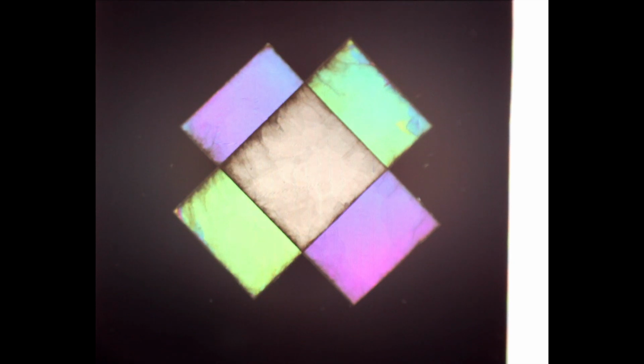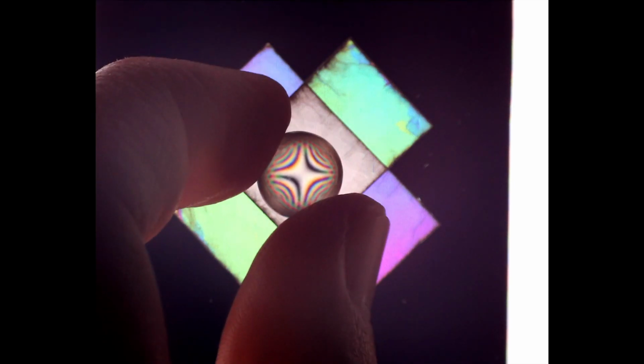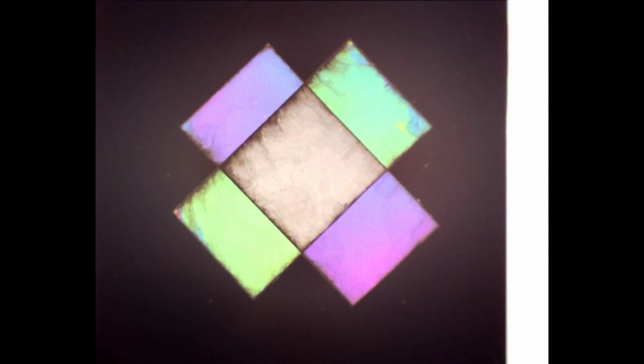Now let's bring in our converging lens to investigate our interference figures. Our interference figures where our mica plates do not overlap haven't really changed at all from before. However, where we have our plates overlapping, we see this totally different and kind of complicated interference figure. I'm thinking I'm going to need a real physicist to help me out with that one. That one there is complicated. In order to understand what's going on here with the interactions of our oriented muscovite plates, we're going to have to go back out to the theory.